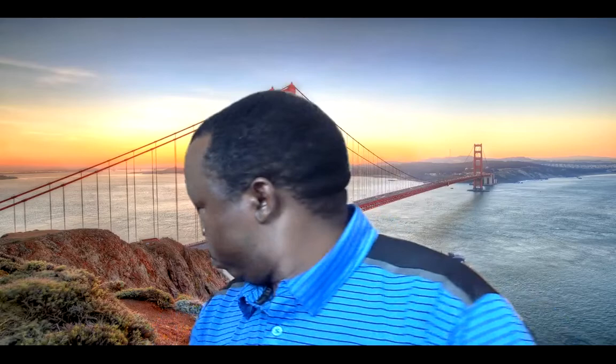I need the mass in grams, all right? And then the same thing you will do for the dimension. This is the length, this is the width, and this is the thickness. You can zoom it if you want to. And record the mass. So I'm going to go back again and do the same thing for the spheres.